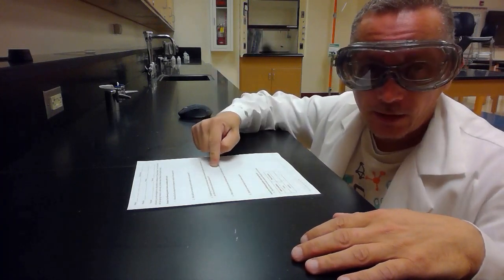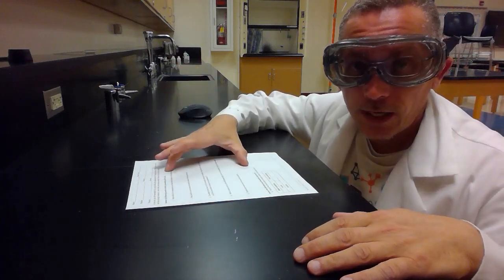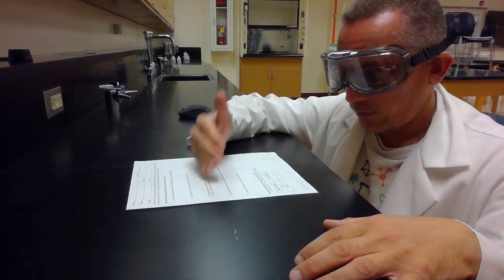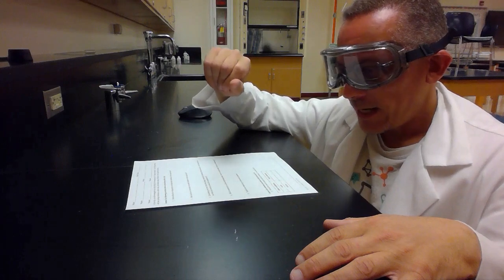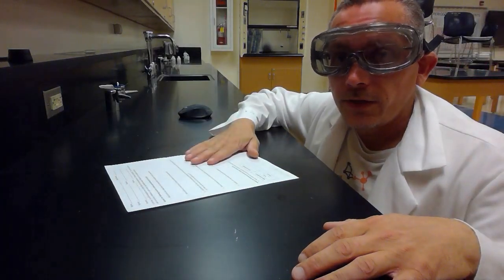Alright, so now I'm in the lab and I've got my safety equipment on. You're going to notice in your lab handout, you might have this on paper or it might be a digital copy, there are some questions for you to answer before doing the lab. So, look at that, make sure you do those questions first. You'll also notice that I did not give you a step-by-step procedure for how to do this. You can write your own procedure. You figure out what steps you need to take to answer the question of how the acidity affects the time it takes the sponge creatures to open.